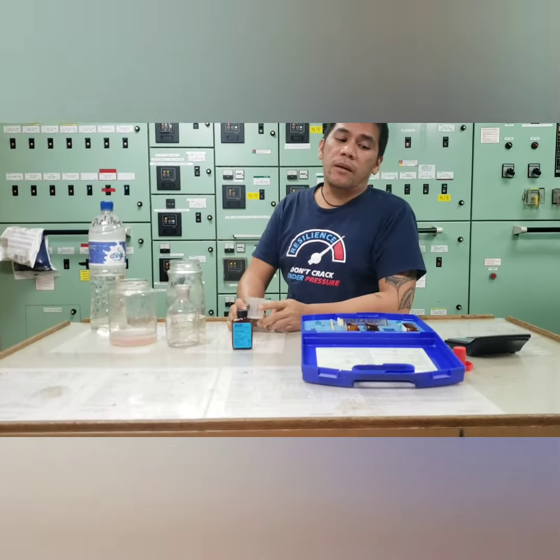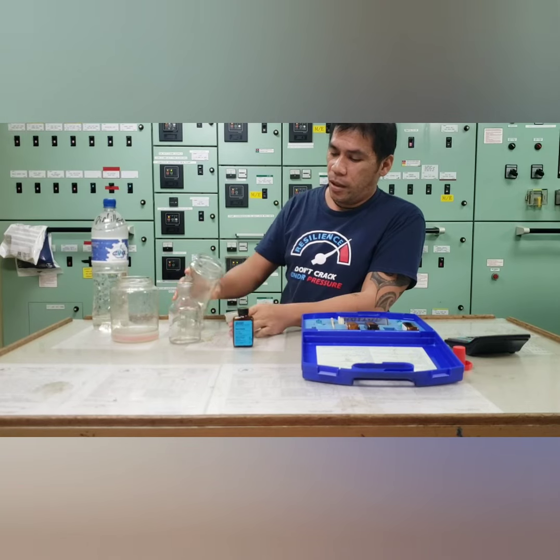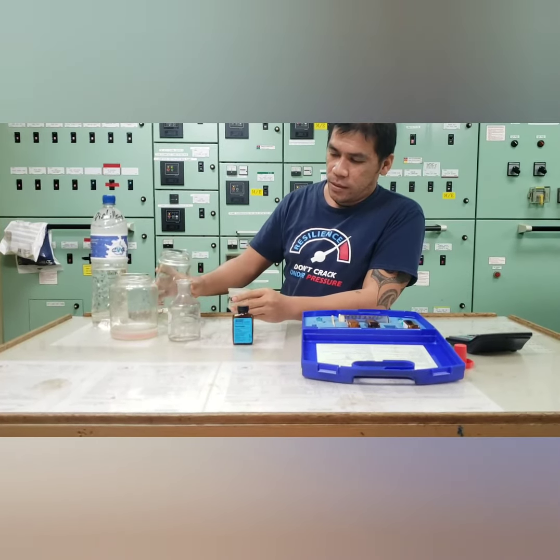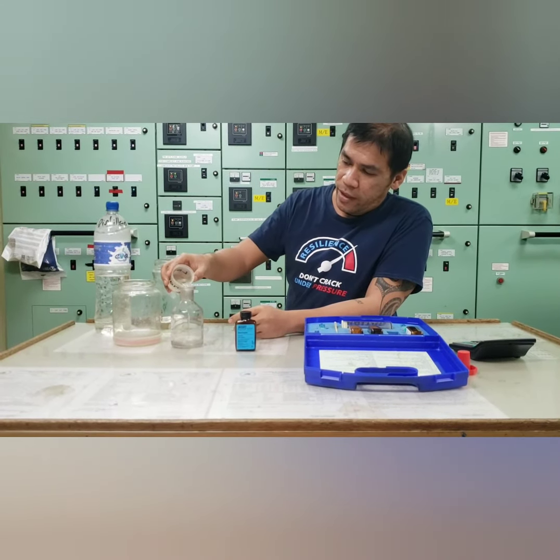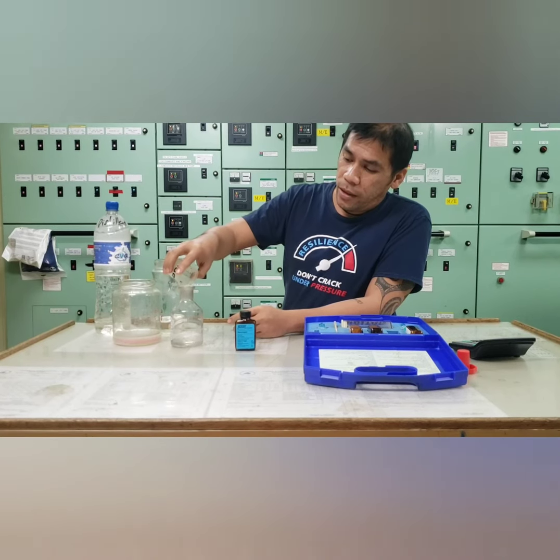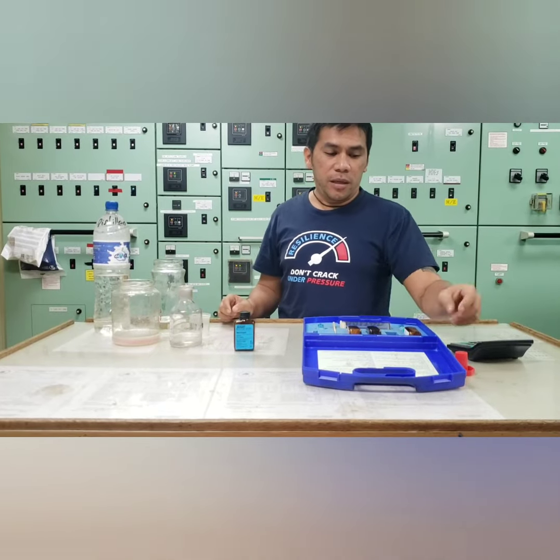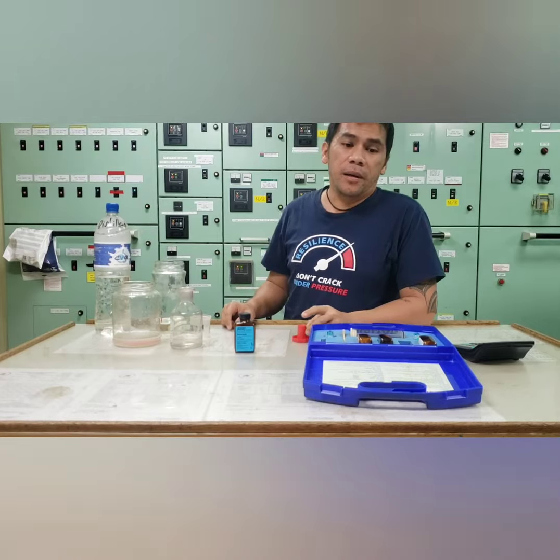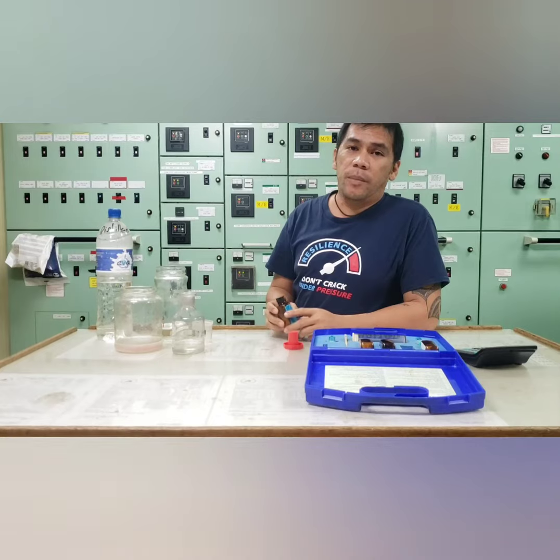So another test we're going to take is the chloride test for our system. So we will going to have a 50 ml sample. We will put in our test bottle. So we will see the color of our water cooling system if there is a content of chloride. So what is the chloride test for? So this will determine if our system was contaminated by the salt water.